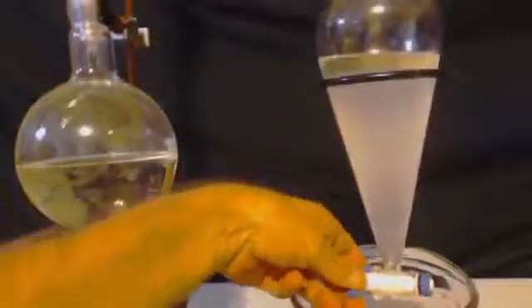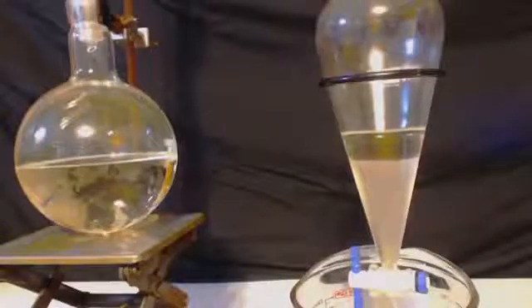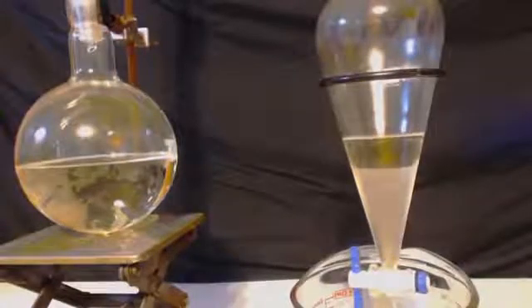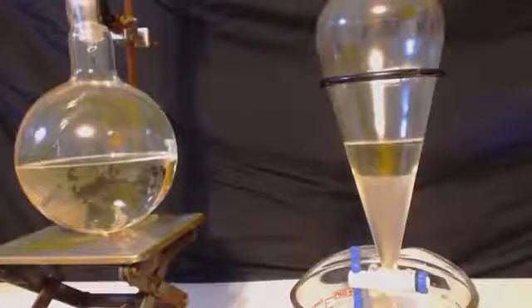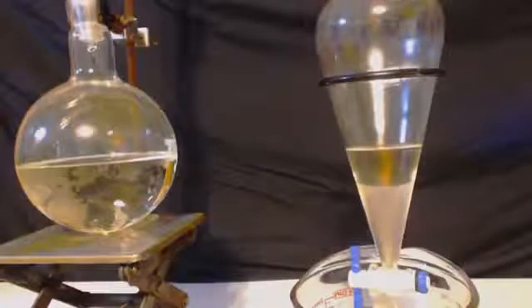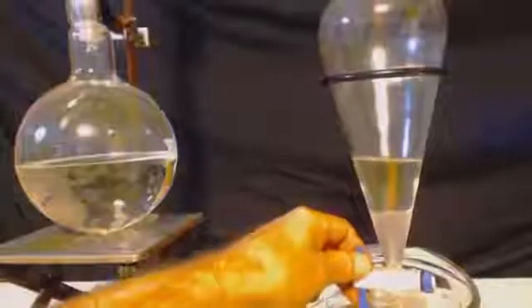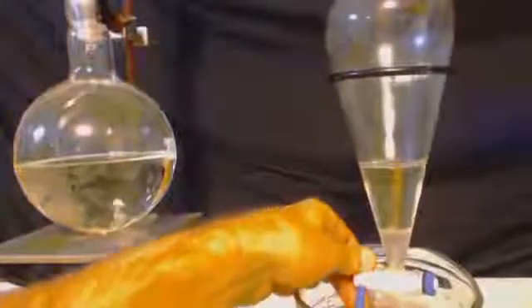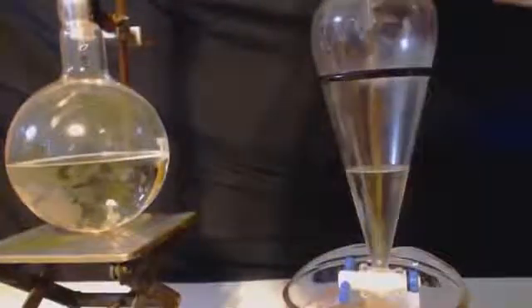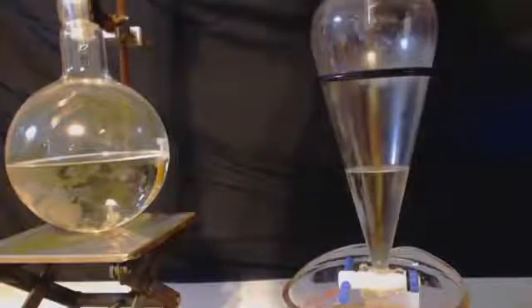Here we go here. This is the second half of the can. I put some water in there, and you can see it's draining out. Like I said, one wash will never be enough, so it's always good to at least do two washings. So, I'll drain that out there, and I'll put some more water in there and do the same thing.